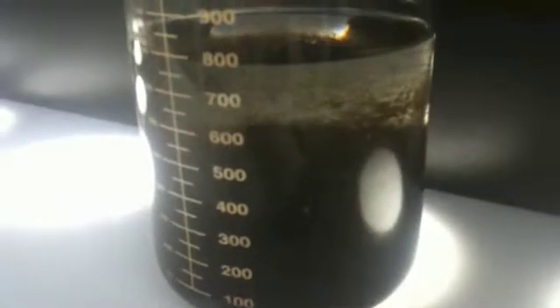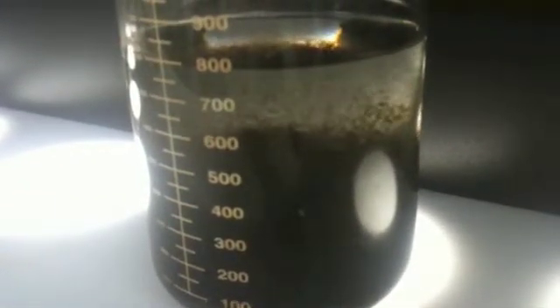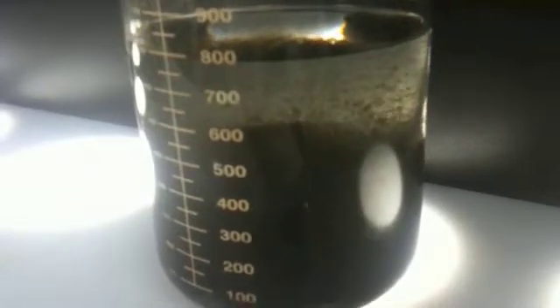After only a few seconds, the weight of the coagulants brings the flock, or sludge, to precipitate to the bottom. You can appreciate the crystal clear water on top, which is one of the advantages of electrocoagulation.